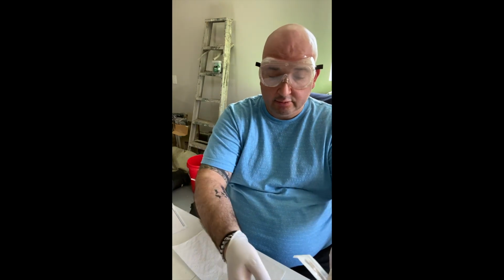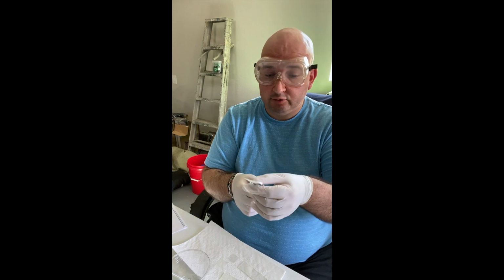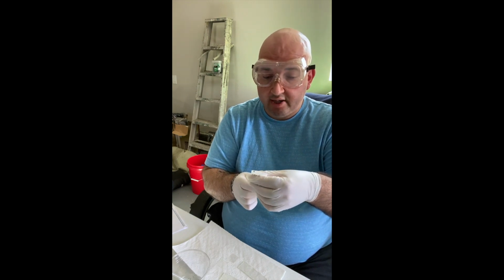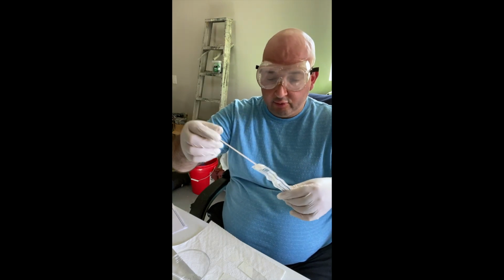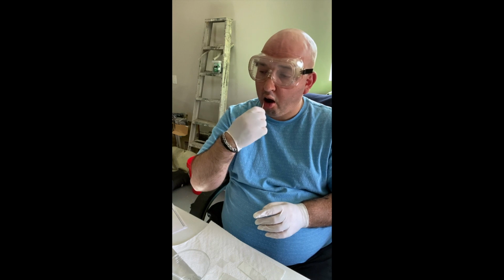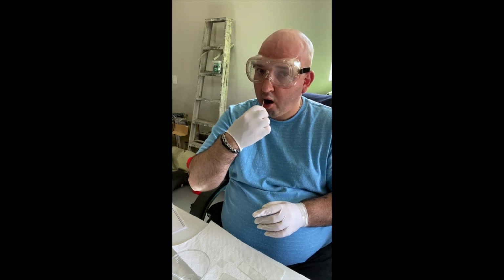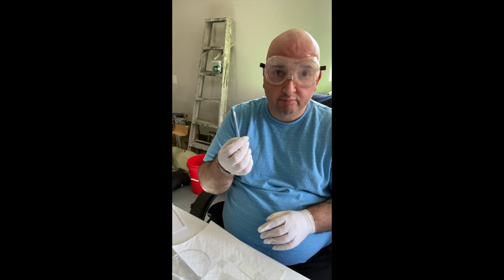All right, so I'm going to place my pipettes into my distilled water here just to make it easier to access. And then as these swabs are sterile, I'm just going to push one out of the packaging just to maintain their sterility here. And again, I'm going to start with my cheek sample. So I, of course, won't be able to talk during this part. Okay, so that's a pretty decent sample.